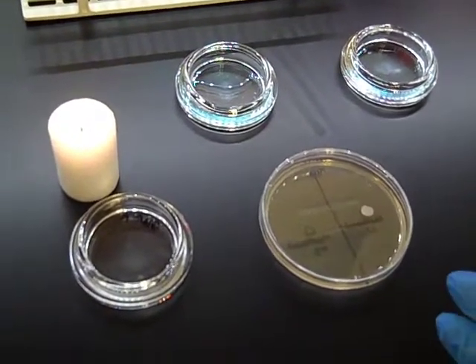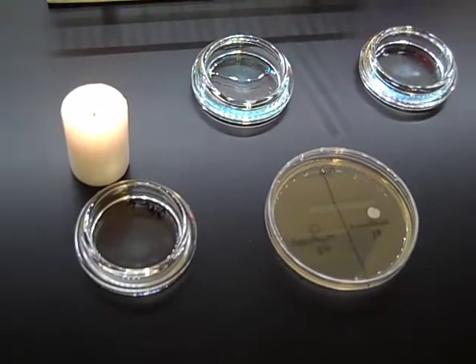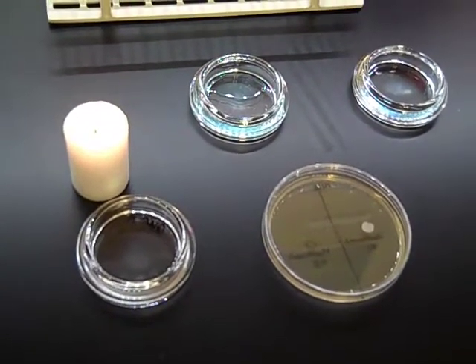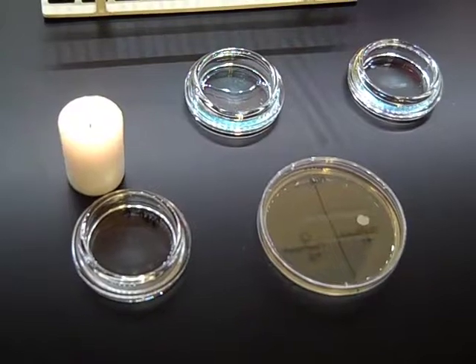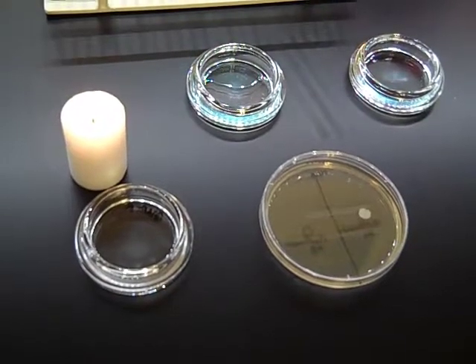And you're going to do this for all your plates, one, two, and three. Then you're going to incubate the plates at 37 degrees for 48 hours, and do not invert them.